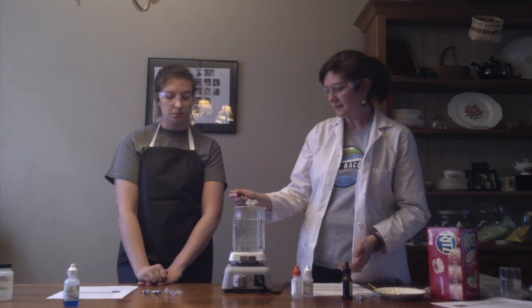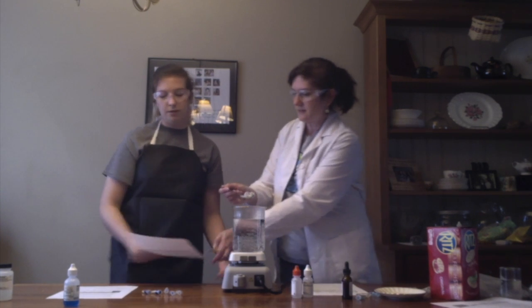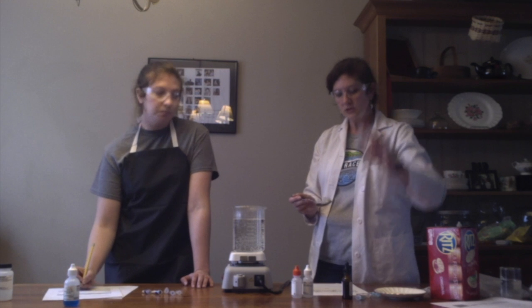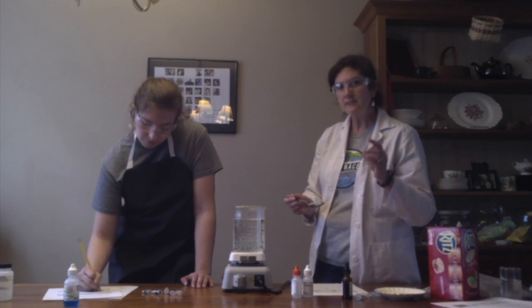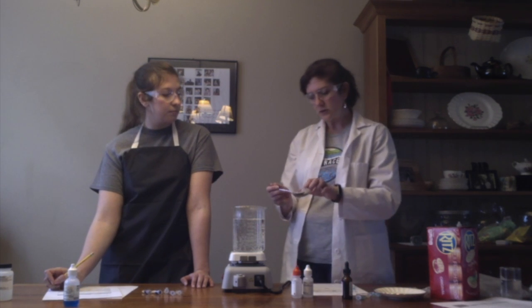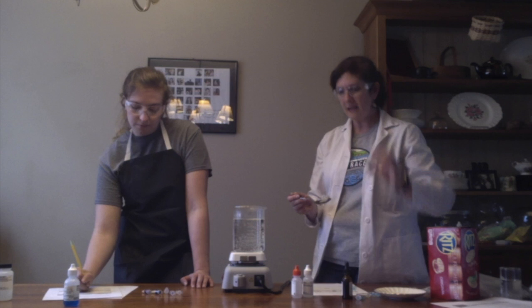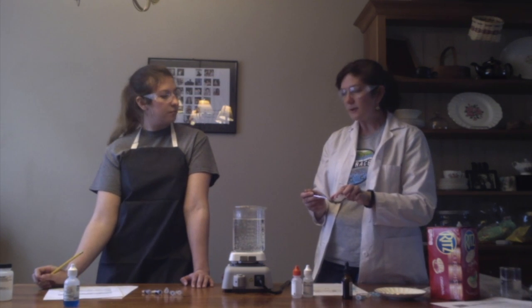All right, so let's take a look now at our results from our test with the Benedict's solution. I'll pull these tubes out, and I'm going to ask you to write down the data this time, Liz. Sure thing. Okay, so tube 1A, which was just water, there's no change. It's blue. Our control worked. Since it's blue, that means no sugar was detected. Okay, for tube 2, which was our starch, correct? This is also blue. Again, no sugar detected.